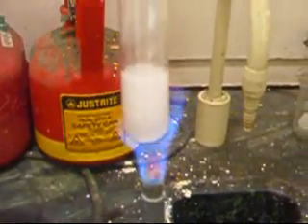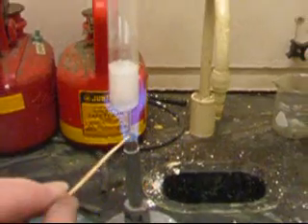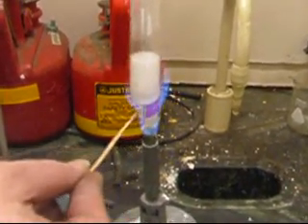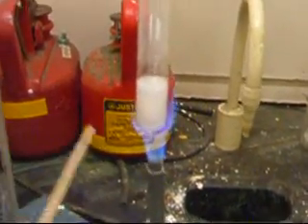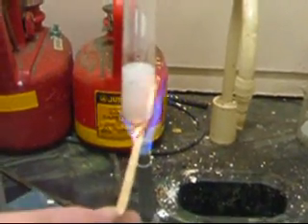You see if a glowing splint reignites. You can see there's a little bit of smoke coming out the top. As this thing is starting to really bubble, I've got to get this to burn. We'll see if this reignites — and yes, there is oxygen in there. So now I have an oxygen-rich atmosphere.